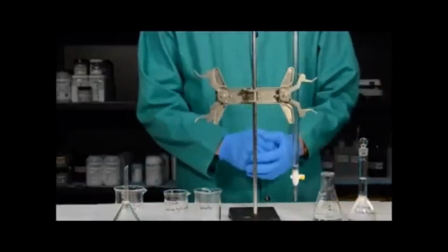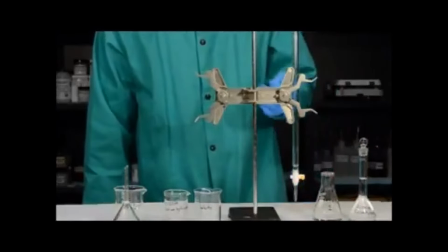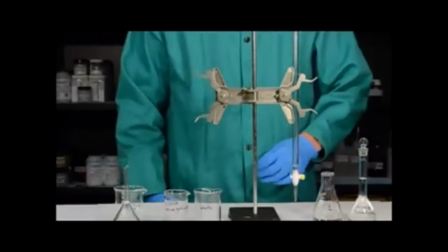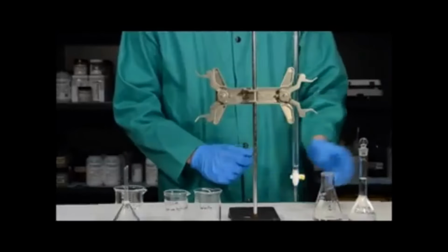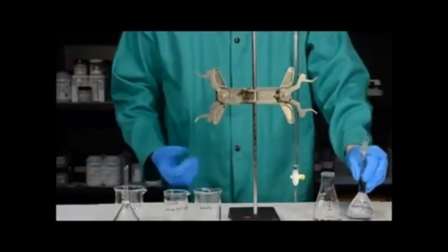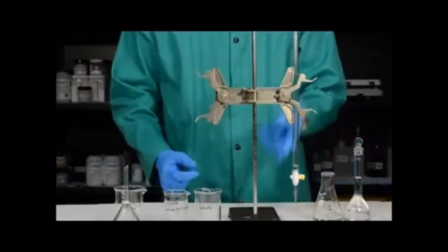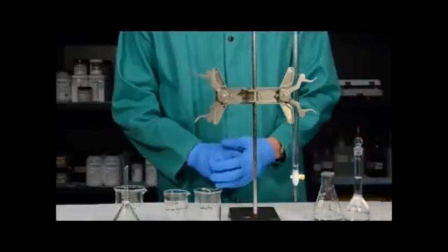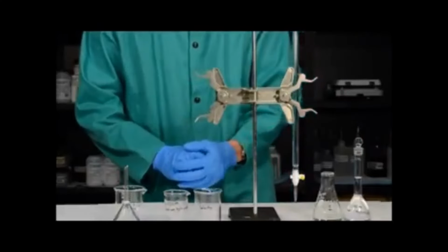Before and after you use a burette, it's always important to rinse it with water. We rinse it before to make sure it's clean before adding our sodium hydroxide solution. We rinse it after to make sure that there's no remaining sodium hydroxide solution. Remember that sodium hydroxide solution contains sodium hydroxide, and if the water evaporates, that'll leave solid sodium hydroxide in the burette. The burette has a very tiny hole at the end and it can become easily clogged, so it's always important to rinse a burette before and after we use it.